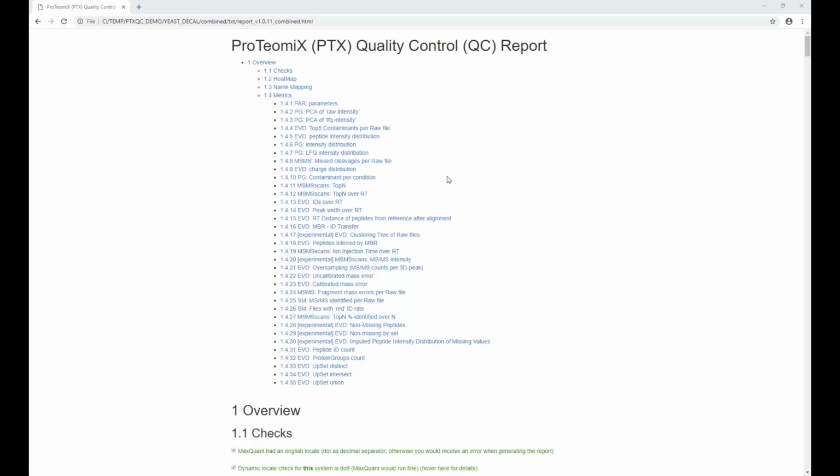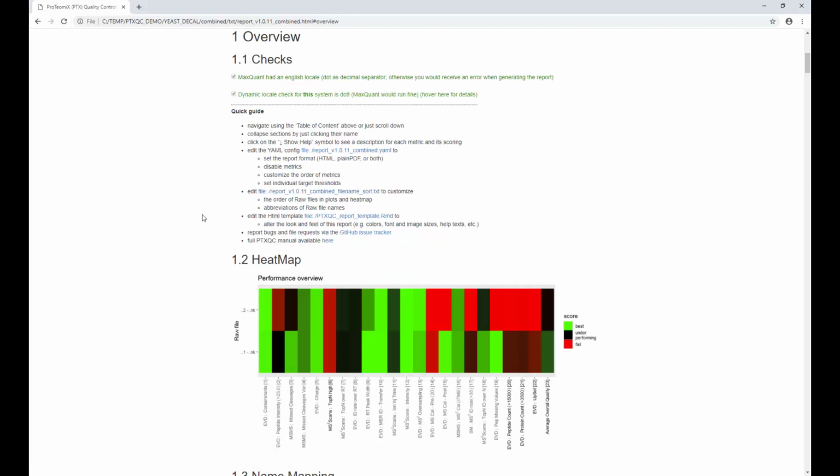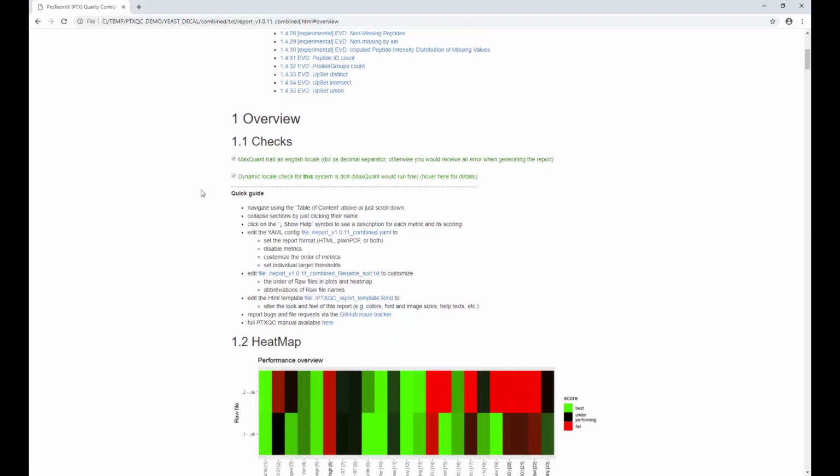The number of metrics you see for each dataset depends on the type of dataset. So in this case we have 35. Now let's quickly jump to the first section, which is overview. So here you can see a neat little feature of PTXQC. If you run MaxQuant in a non-English locale, meaning where dot is not the decimal separator, MaxQuant will generate bogus results. Usually the number of PSMs will be very low, and MaxQuant won't tell you that something went wrong. So PTXQC in this case will detect this problem and it will not generate a report.